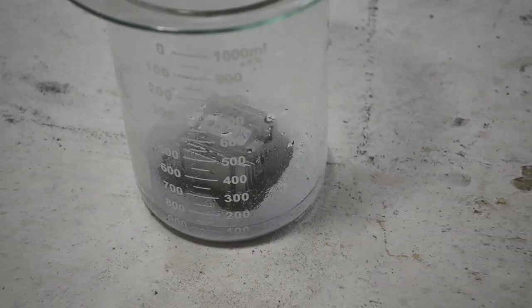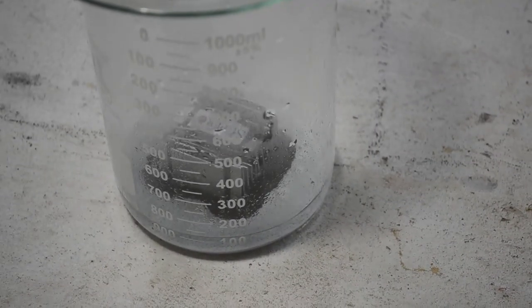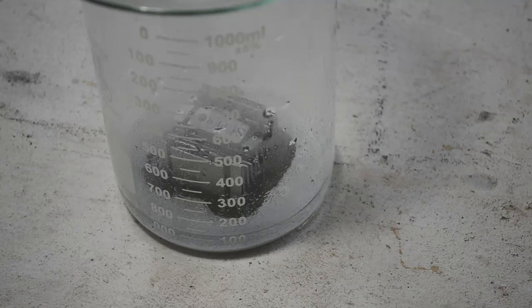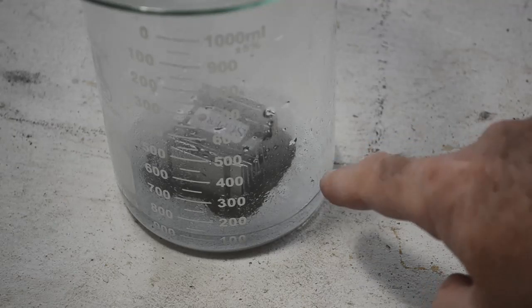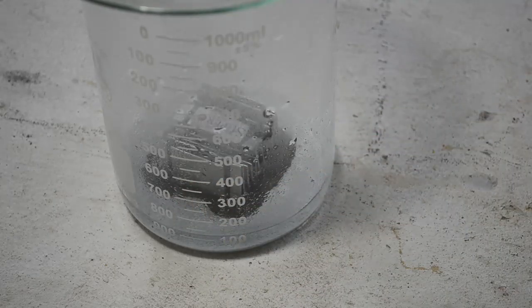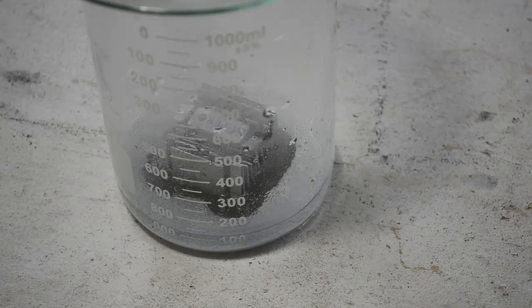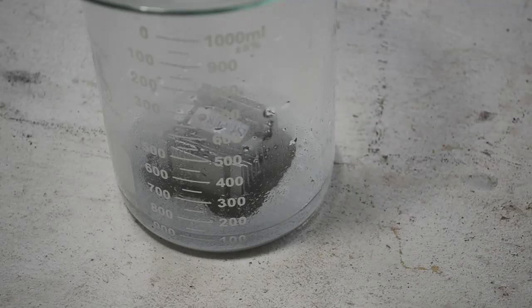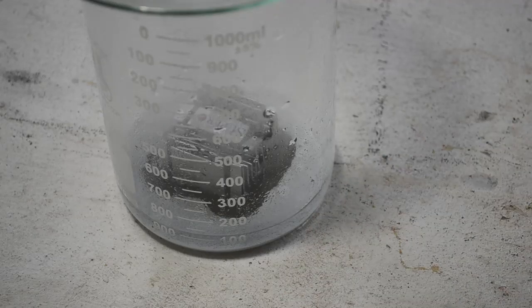I was just going to put this in my fume hood and leave it for a couple of days and come back to it, but I couldn't resist having a look at it. It's only been a few hours. Look at the black spreading around the heat sink in there. There's some magic going on. I'm going to put this back in the fume hood and leave it until it's all black.